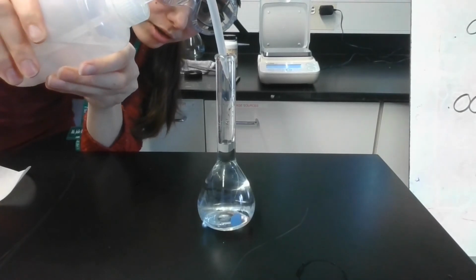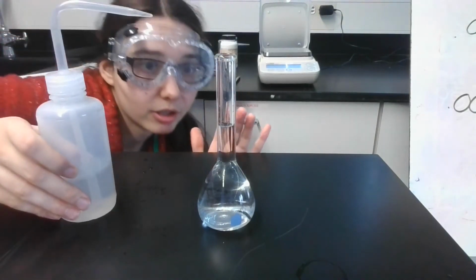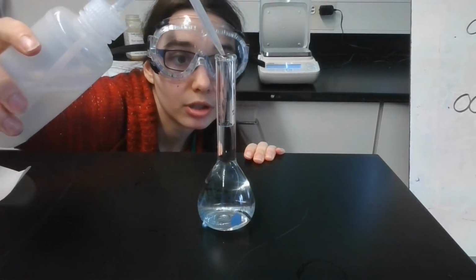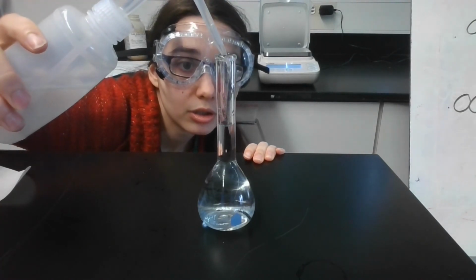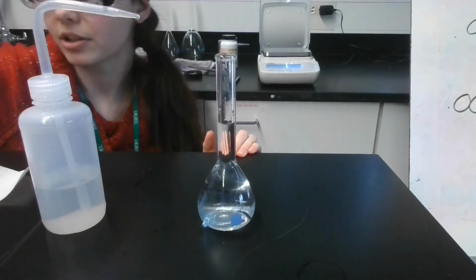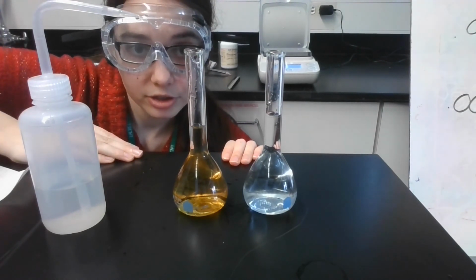Okay. Oh, okay. If I get it eye level, it is just barely under. Okay, there we go. All right, so here are our two solutions. They're beautiful, and that's how you do the calculations and prepare a solution.